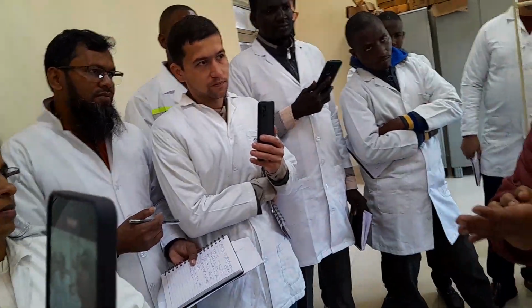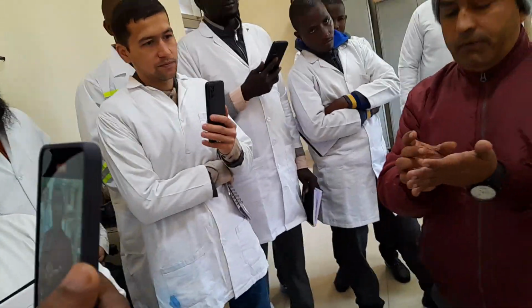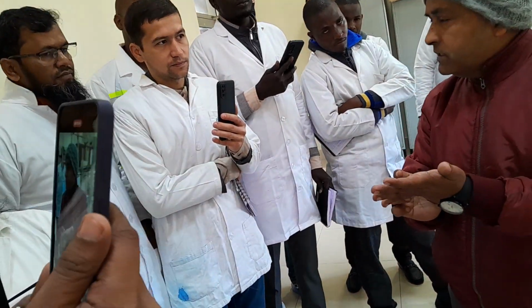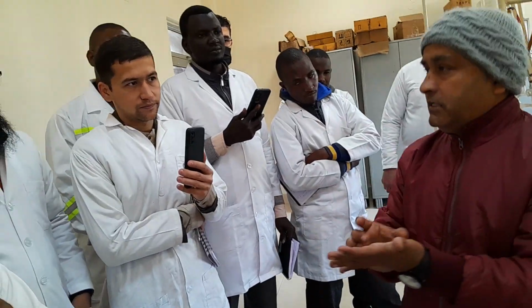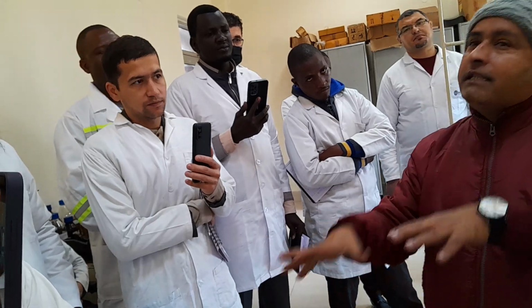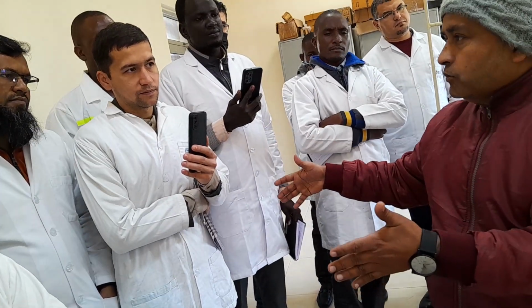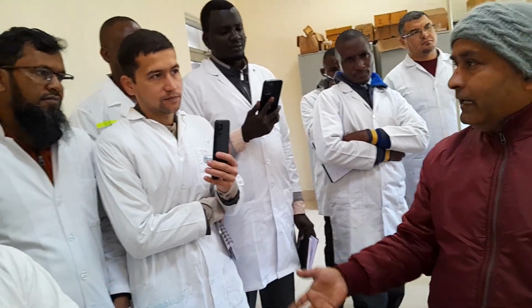Only we will mention it in the report, nothing else, because the Reid vapor pressure is this much and the crude oil is not in stabilized condition. That is why my loss is this much, so that they can take care in the refinery. This crude oil is lighter, so we have to take care of that. So it has to be mentioned in the report.